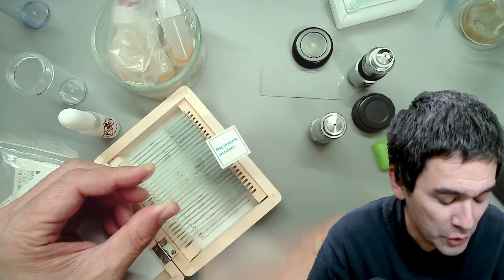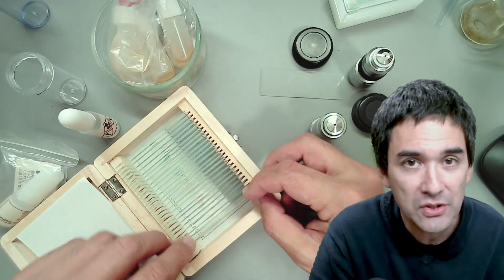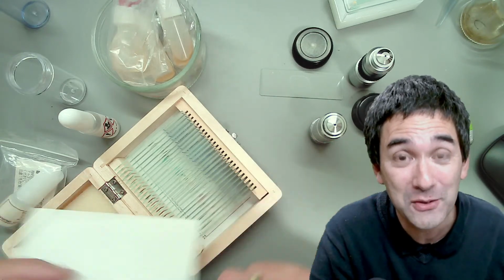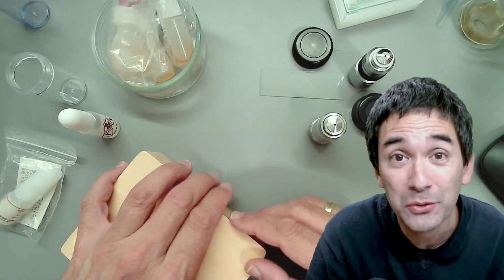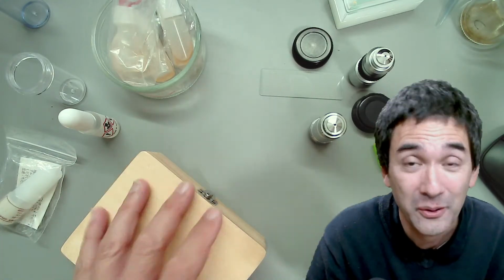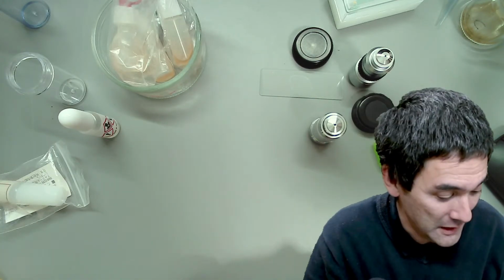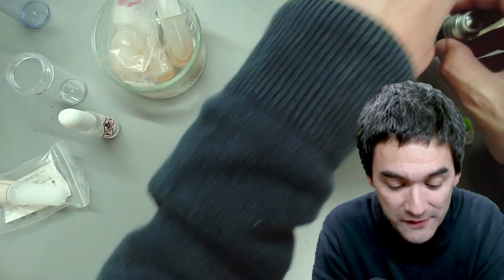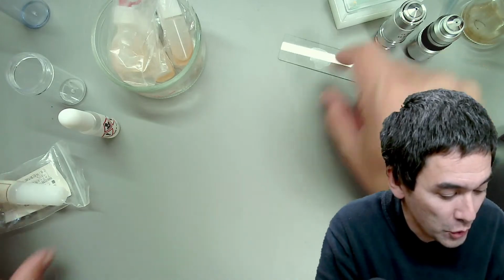So I'm just saying there are some limited uses to oil immersion, but sometimes there is no way around it. For some of the videos that I made, I had to use the 100 times oil immersion, because otherwise I would not have been able to see it that well. So that's number one. Remember the correct objectives. Number two, let's have a look at the immersion oil itself.